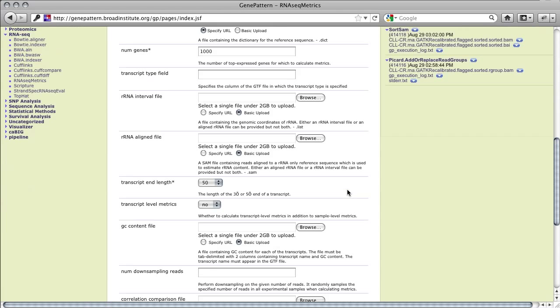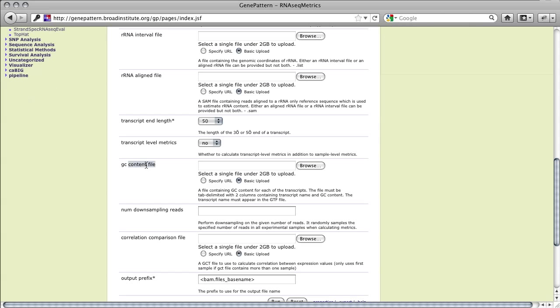Other parameters to note are num genes, which will determine the number of top expressed genes for which to calculate metrics. By default, we set this to 1000, however this requires at least 3 GB of memory, so you may need to reduce this number depending on the configuration of your machine. Transcript level metrics determines whether to calculate metrics at the transcript level. This is memory and compute intensive as it produces more detailed results, and thus will also produce more output files. By default, we set this to no, and will leave it set to no for this tutorial. GC content file: providing this file will produce an additional section of results pertaining to the GC content of each transcript. For this tutorial, we'll not be providing this file.